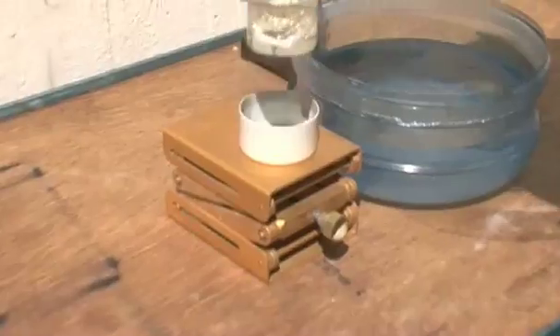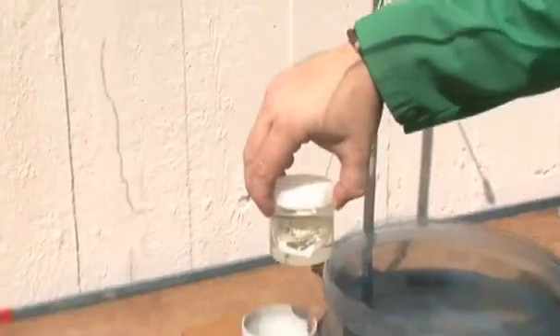At the moment, the caesium, you can see the lovely gold color. It's melting, oh yeah, it's very warm. The caesium's melted.